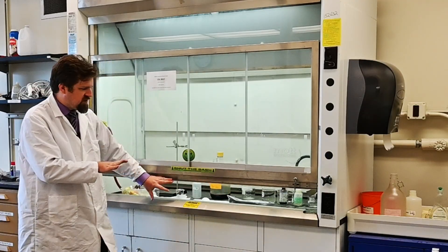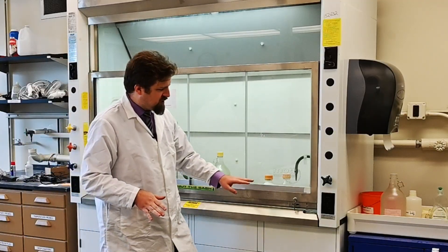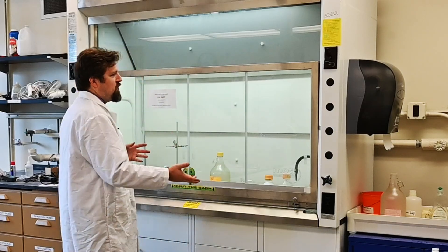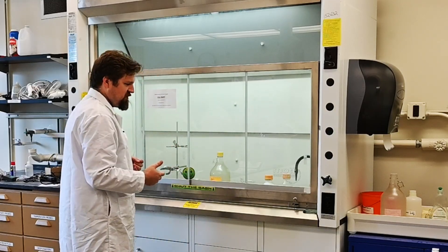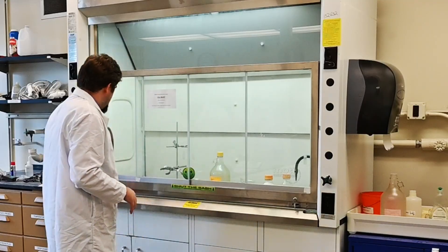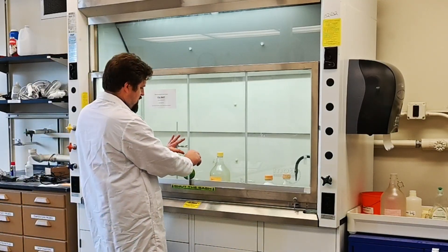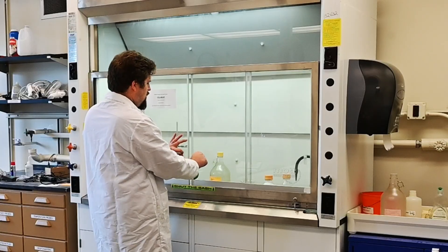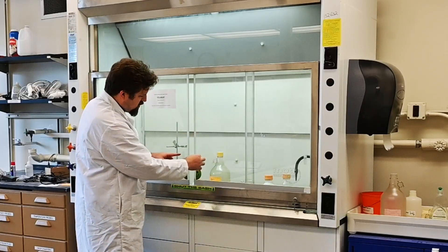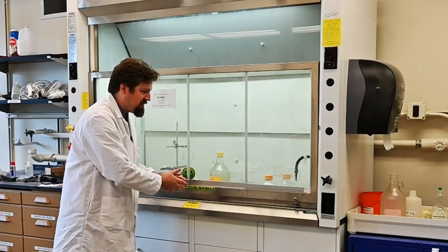Also note that some fume hoods — not this one — you're not actually supposed to close all the way because it creates a vacuum when turned on and could damage the fan. This particular model has little gaps that allow it to work. Another thing about this model is it has these cute little doors you can open and access if you don't want to mess with the sash. Just make sure when you close it, it goes back to the appropriate place — indicated here by a smiley face.